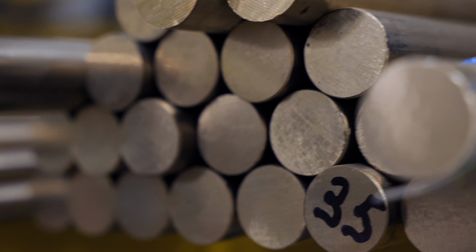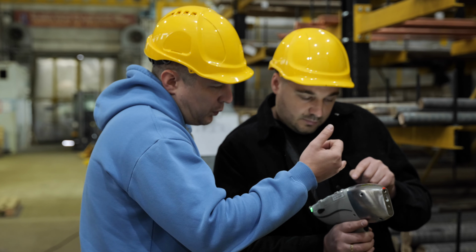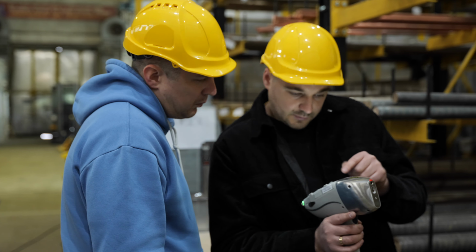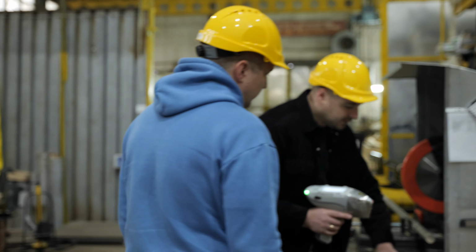For example, you have a batch of unmarked stainless pipes. You place ProSpector 2 on the surface, run a measurement, and in a few seconds you see alloy grade 304, match 97%, for example. And you don't manually analyze the composition and don't search tables, the analyzer has already done this for you. That's why alloy grade is ideal for fast preliminary identification.